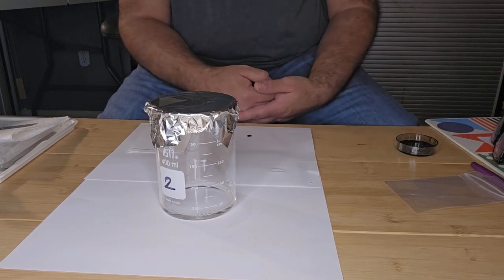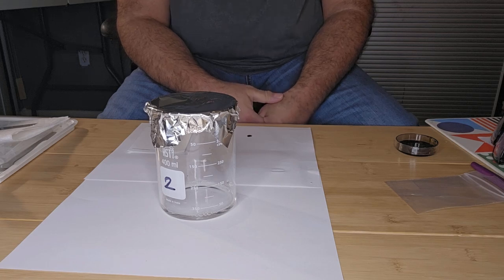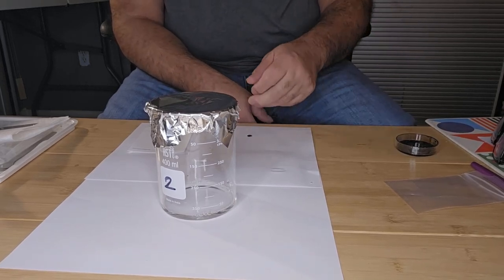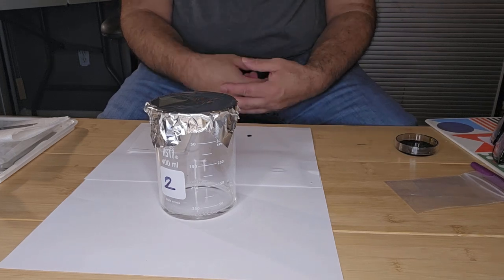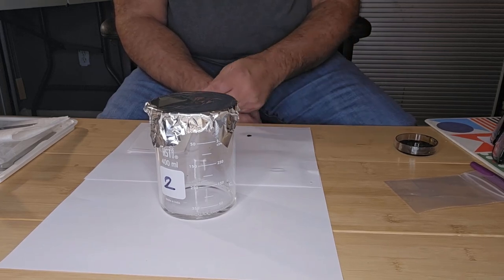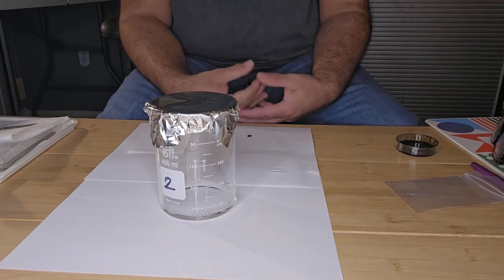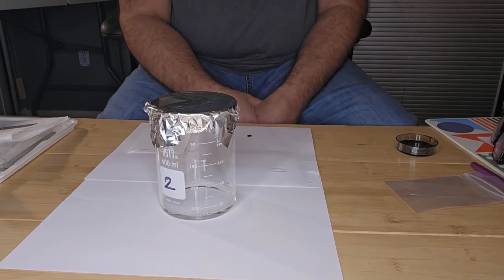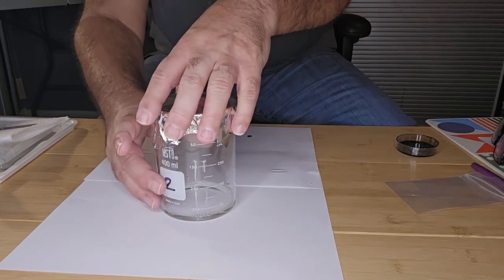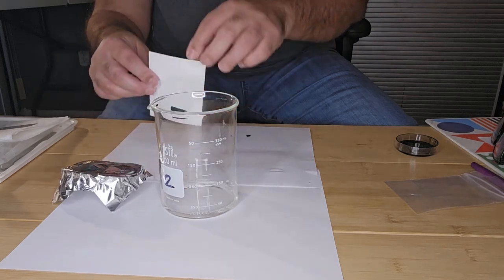Okay, my mixture is dry now. It's had enough time to dry, so it's time to put it into the chamber. What you need to remember is you don't want to put so much solvent that it reaches your application line. You want the solvent way below your application line so that the mixture doesn't dissolve in the solvent and contaminate it. So I'm going to remove the foil and then add my paper.